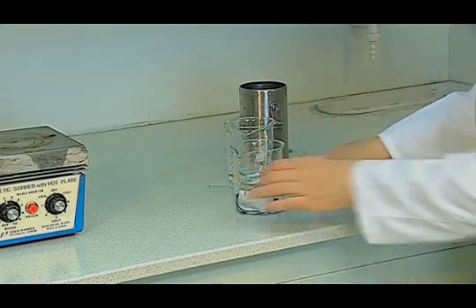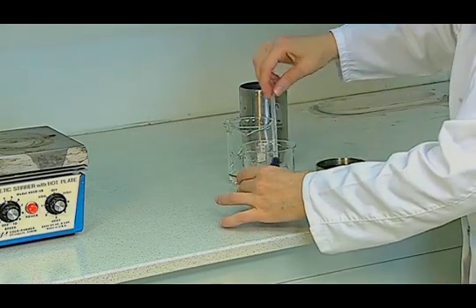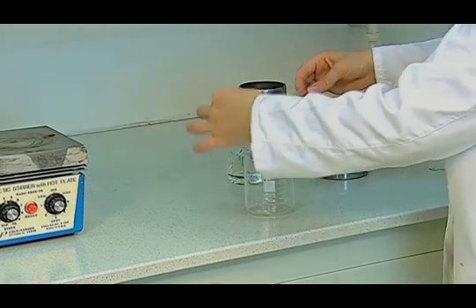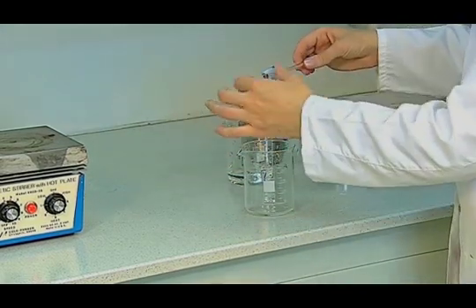Water is filtered. Along one of the short sides, the test sample is dried in the oven at 60 degrees centigrade.